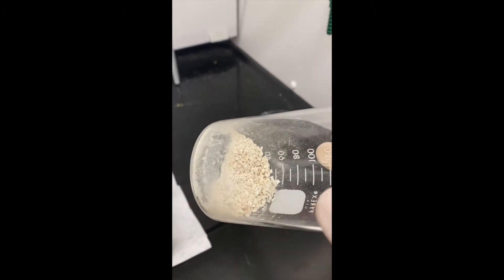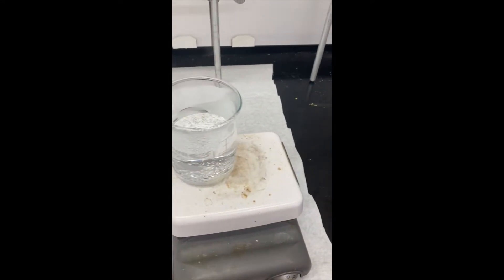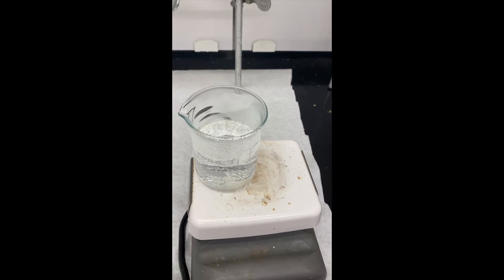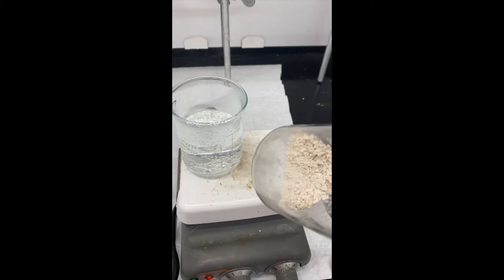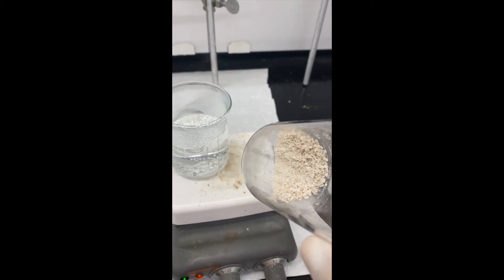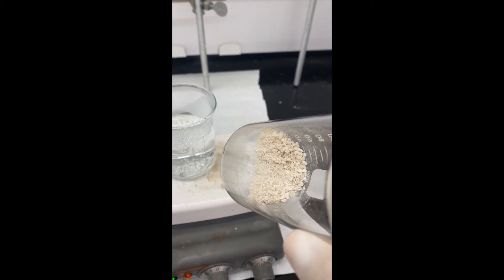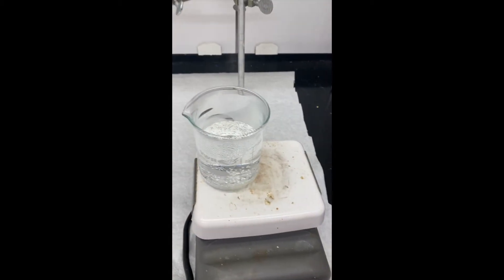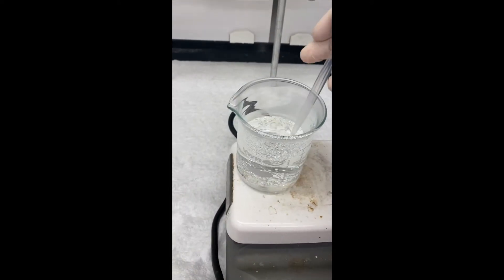Ideally, you'd like to see crystals and you see this is just like powder. So we're going to recrystallize it using a solvent, in this case water, where the solid is going to be soluble at high temperatures and insoluble at cooler temperatures. So water has been chosen for this recrystallization.